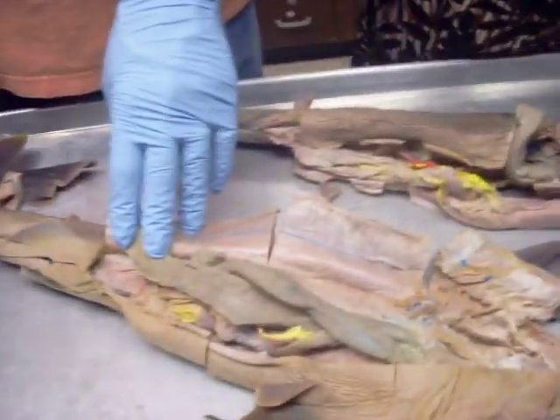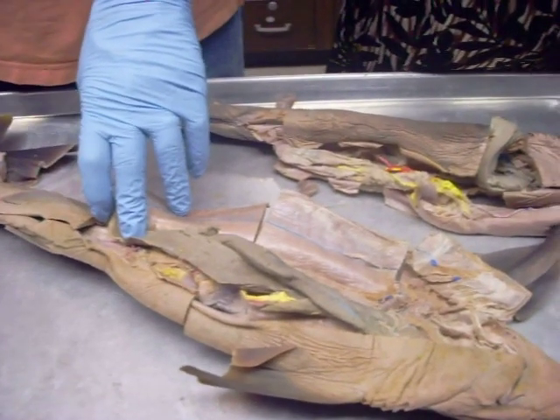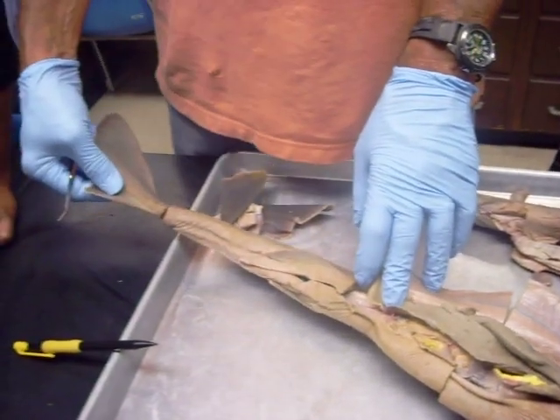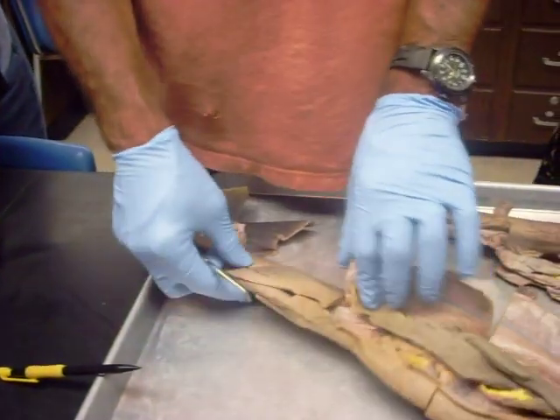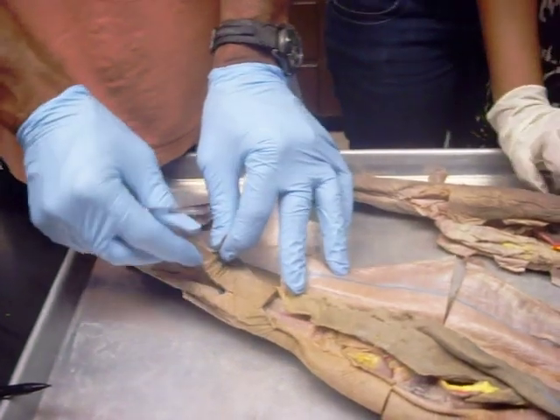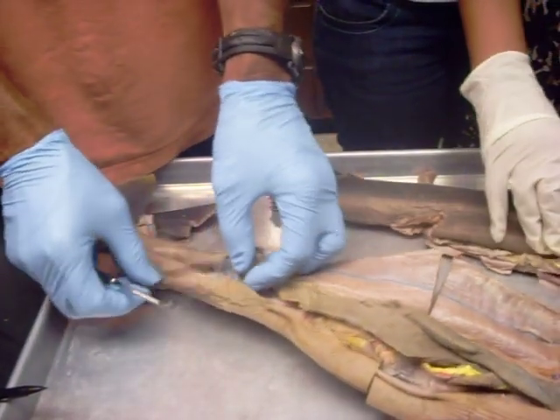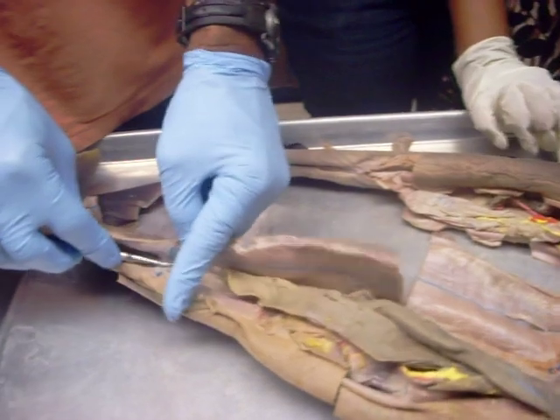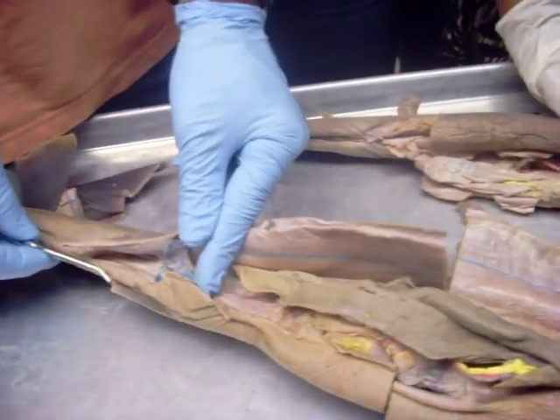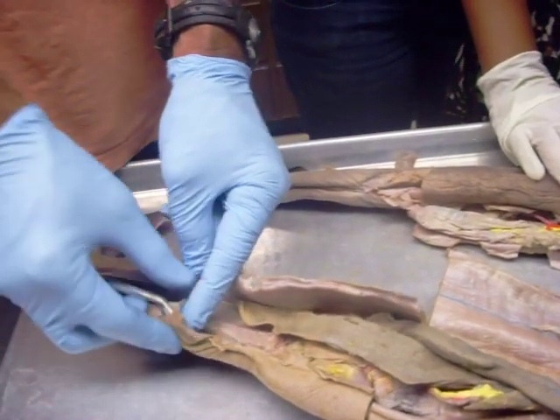Since I've been easy in the past, this is the caudal fin right here. If I stick a pin in that, just put down caudal fin. This is a male, and these are the claspers. If I stick a pin in that, it would say claspers. This opening right here is the cloaca. So that's the cloaca, the caudal fin, claspers, cloaca.